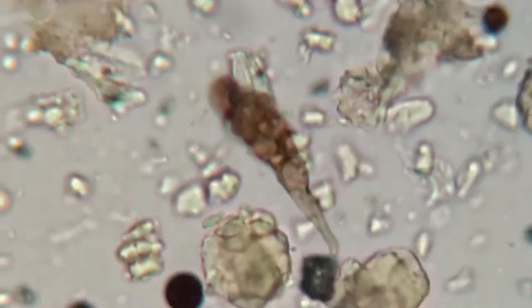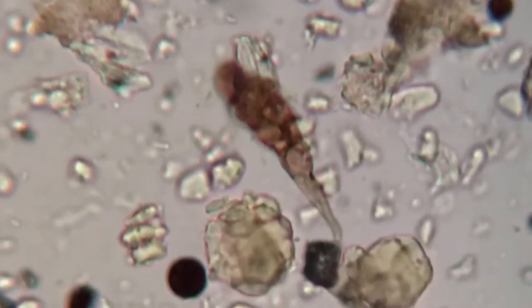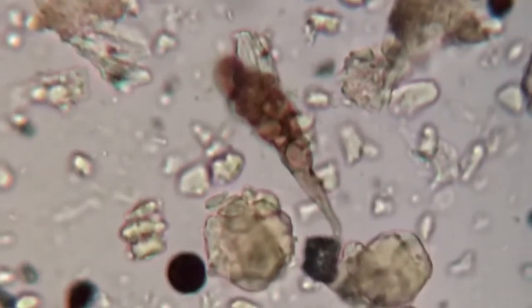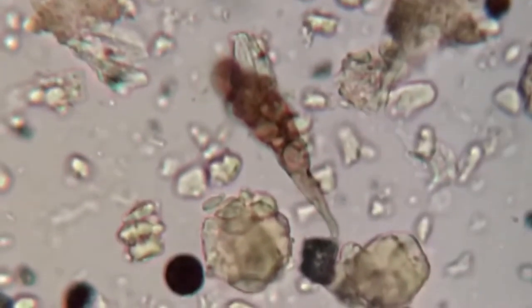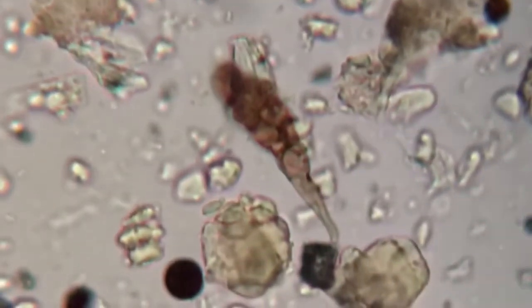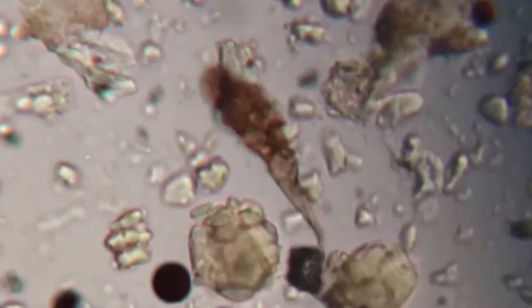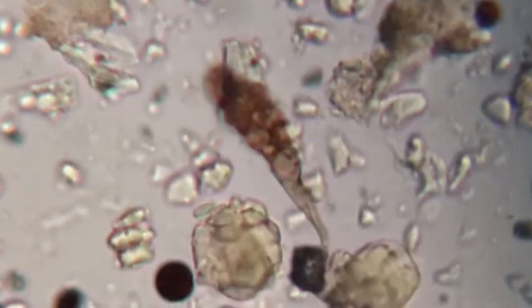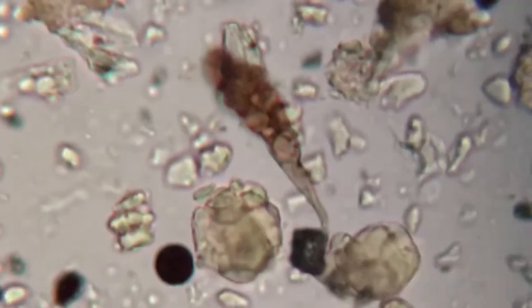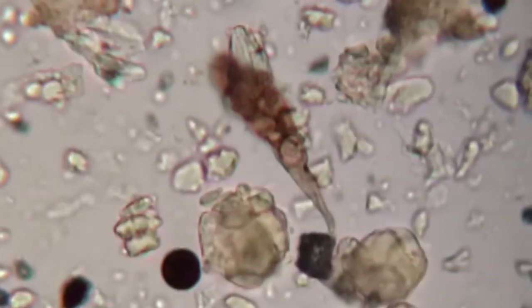Something to be aware of when you're looking at microbes under the microscope is that if you're taking soil samples using the methods we use for our MDD analysis, you're going to be looking at a lot of different sizes of organism. So you're going to have different planes of focus, and what I'm going to do here is adjust up and down on the focus so that you can see that.